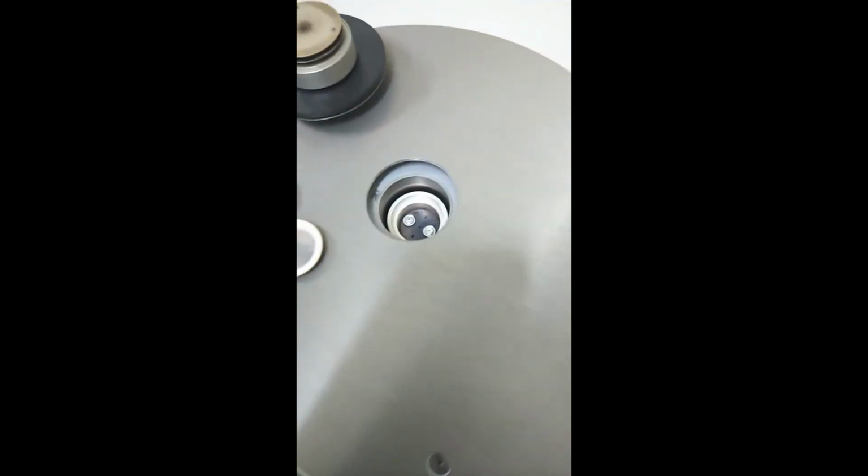So there's one thing that I would like to mention here: these crucibles are one time use. So you can just use one for a sample and you have to discard it later on. Now this one on the right is our sample, and on the left is the blank crucible. It doesn't have any solvent or the sample inside.